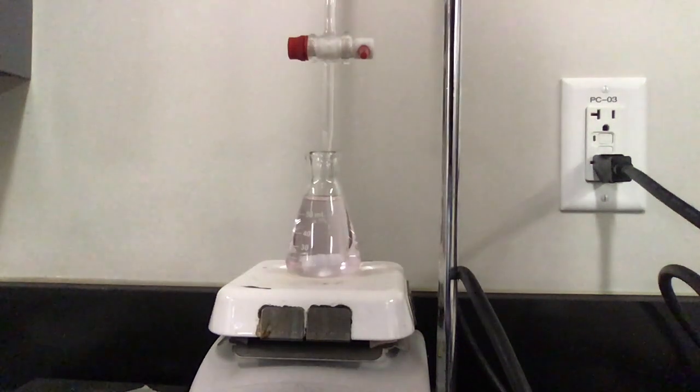Now what we're going to do is we're going to look up here. Oh, wow. It's actually a pretty easy number to read here too. So here is our the number in our burette. I don't know if that light made it easier or harder. I'm going to also take a picture here with my phone. But it looks pretty solid to me. Pretty good to me. I took a picture of it. We're going to try it two more times. I'm just over the halfway mark. So I'm going to have to fill it up a little bit. I'm probably not going to fill it all the way now that I have some general idea of how much I need. So I'm going to do this two more times. You guys can watch, enjoy.